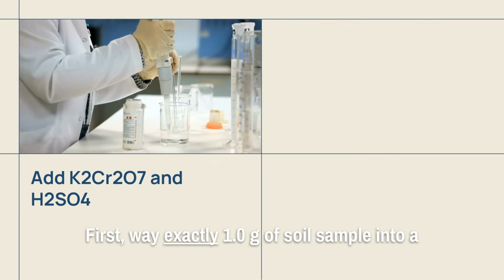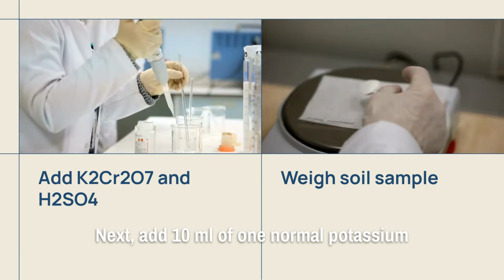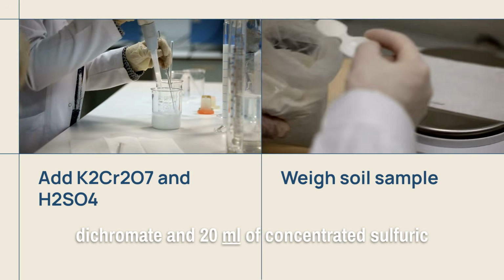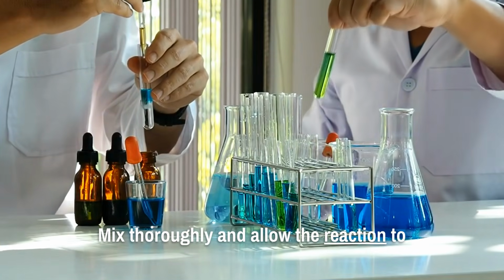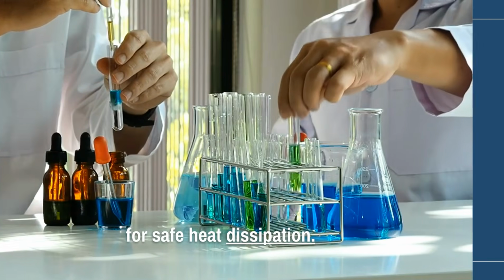First, weigh exactly 1.0 gram of soil sample into a dry conical flask. Next, add 10 milliliters of 1 normal potassium dichromate and 20 milliliters of concentrated sulfuric acid. Mix thoroughly and allow the reaction to proceed for 30 minutes on an asbestos sheet for safe heat dissipation.